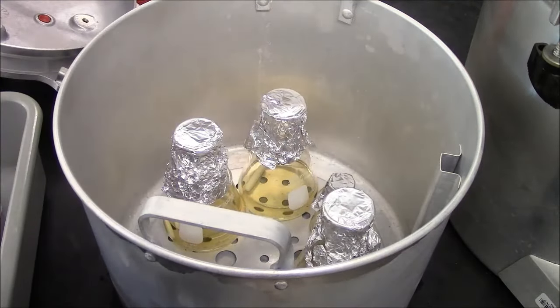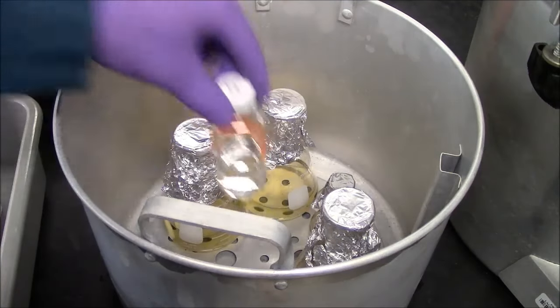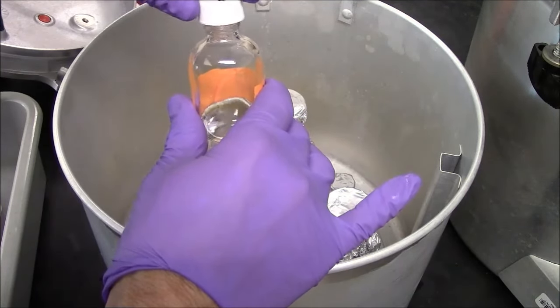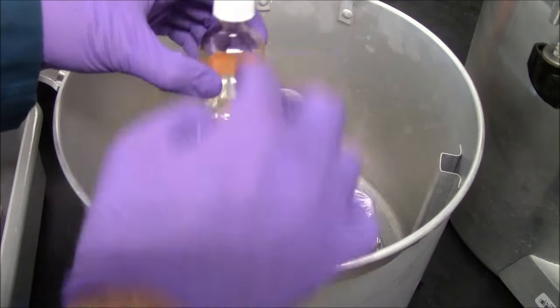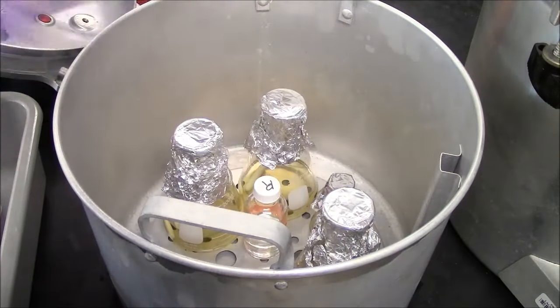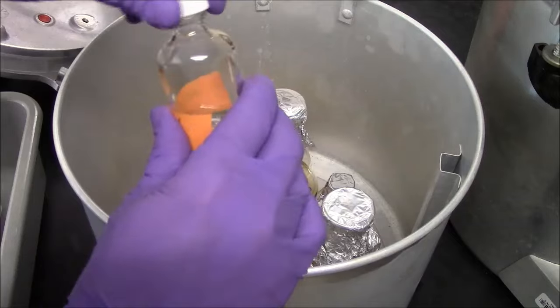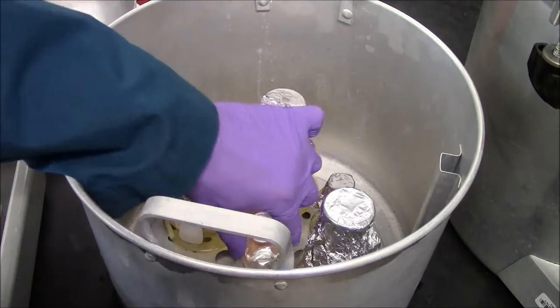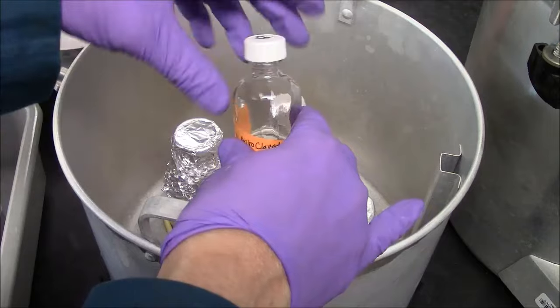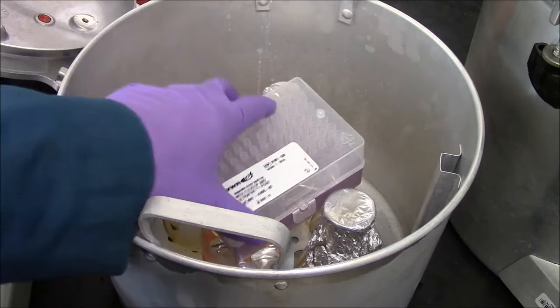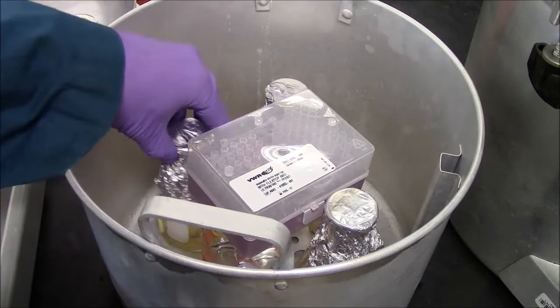So I'm arranging my materials inside the sterilization chamber. These lids must be loose. There will be a pressure difference between inside and outside. So let them breathe by loosening the cap. And here I'll rest the pipette tips in the middle there.